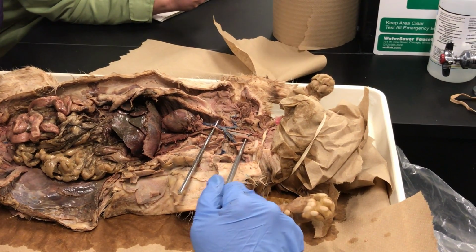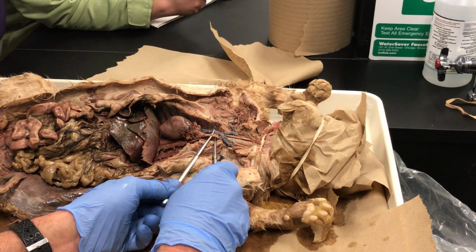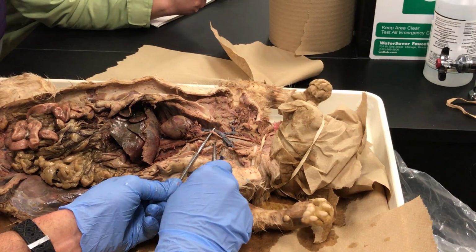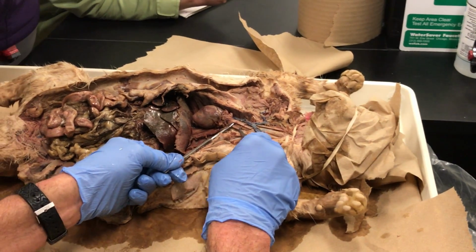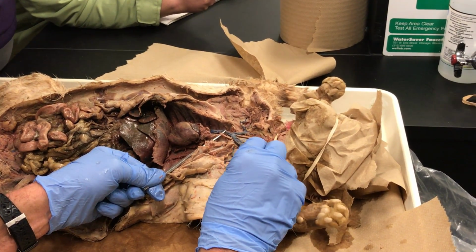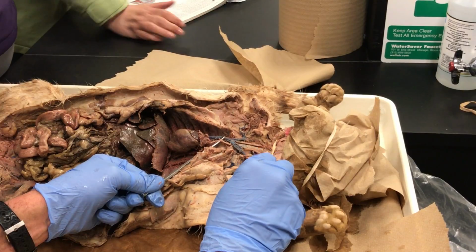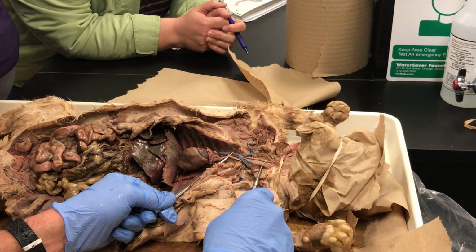So in both of those locations where your probe is, it's the common carotid? First, from here to here, this is brachiocephalic. From here to there is brachiocephalic. And then, yeah, where I had the probe, pardon me, you're right. So starting from here, underneath that tube and all the way up there, that's all common carotid. So there's one on one side of the windpipe, which looks like that vacuum cleaner hose.